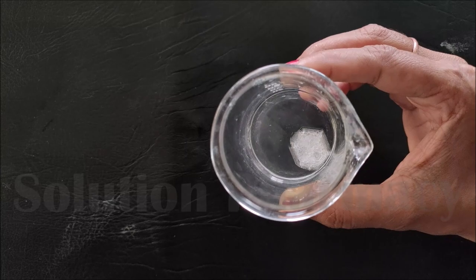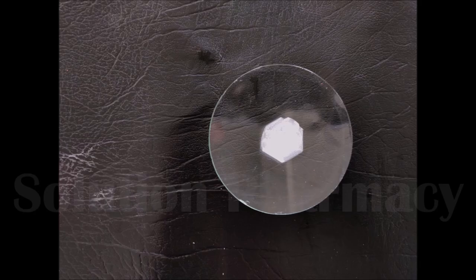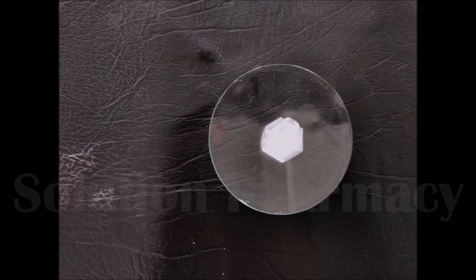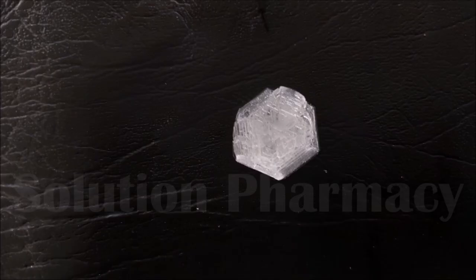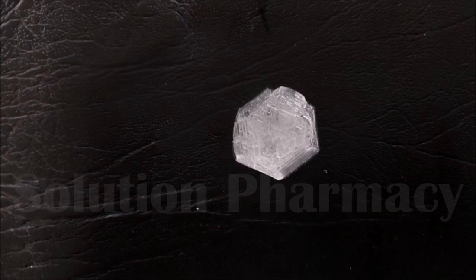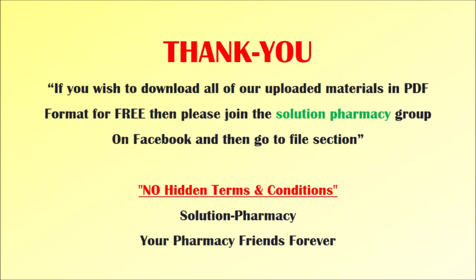After a few hours — observed the next day — you can see that crystals of potash alum have separated out from the liquid. A single large crystal of potash alum is formed in the beaker. Filter it out from the mother liquor, wash with a small quantity of cold water, dry with filter paper, and transfer to a watch glass. You can clearly see the potash alum crystal with its proper octahedral shape. This is how we prepare potash alum in the lab. Thank you very much for watching.